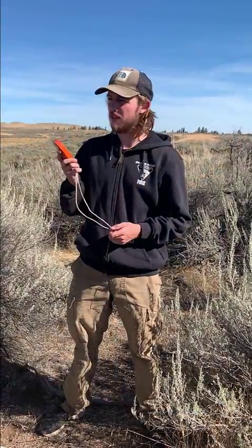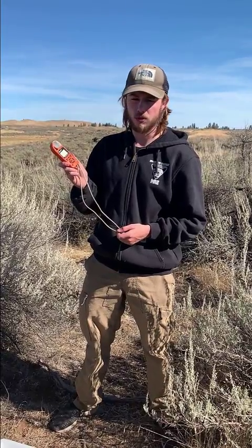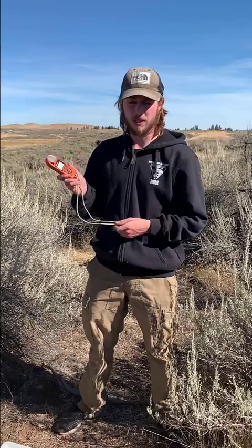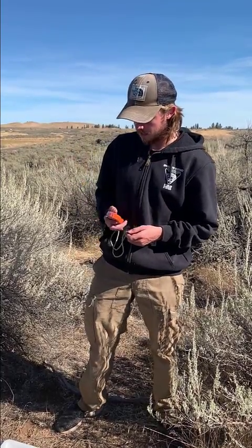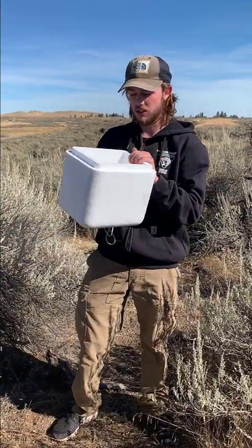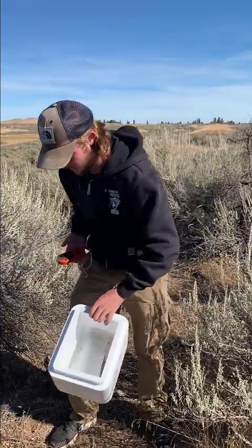At this time, if you'd like to, you can add weather data to your data set. At the Spokane District, we use a Kestrel to record our weather data, including relative humidity, wind speed, and temperature. When you have that recorded and written down, make sure you store your sample in a cooler to ensure that the temperatures for the sample stay relatively consistent.